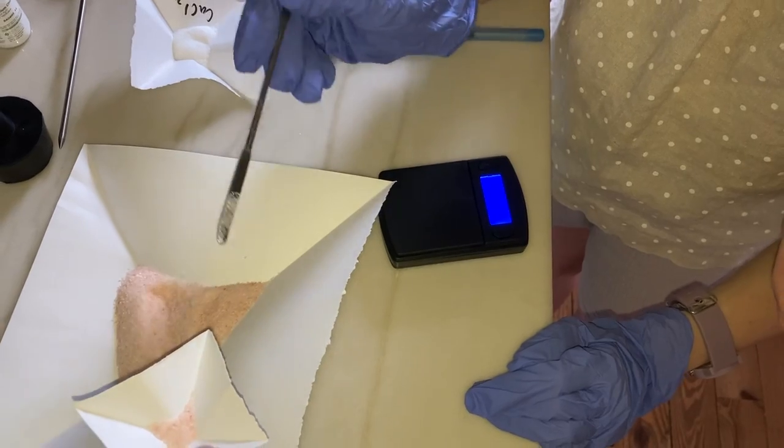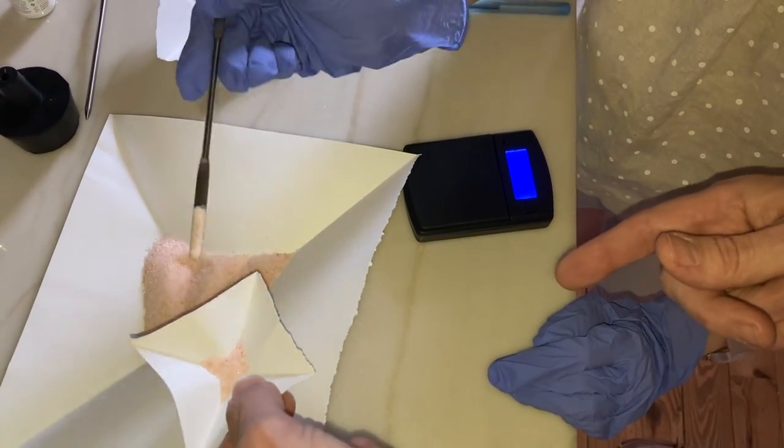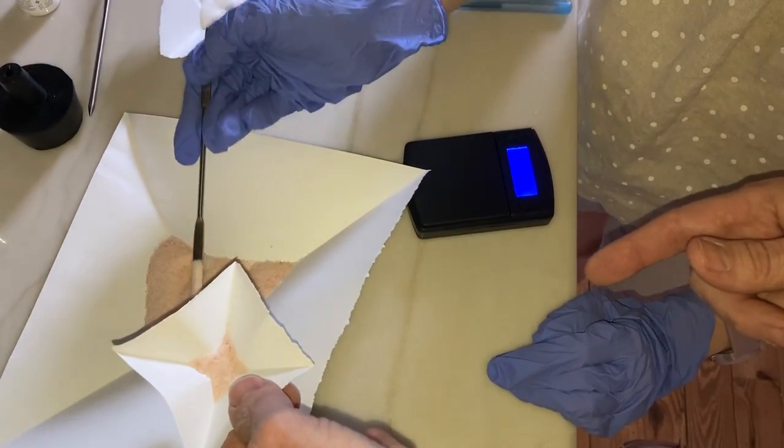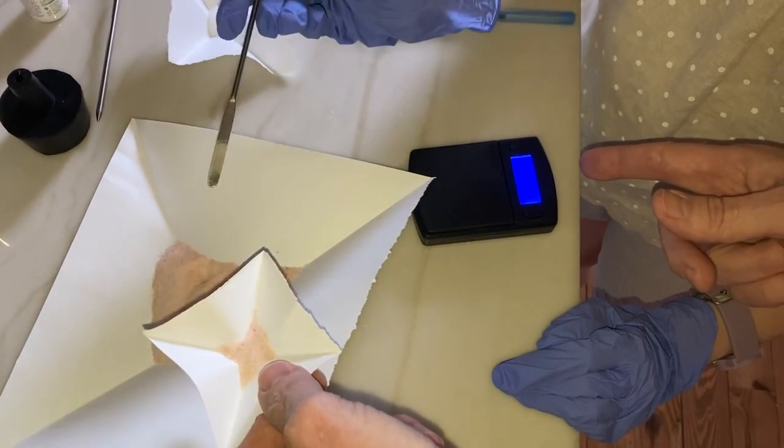Wait, I think that, okay. Take some out of it? Or, oh yeah, it's two grams. Two grams. What? Let's try now.